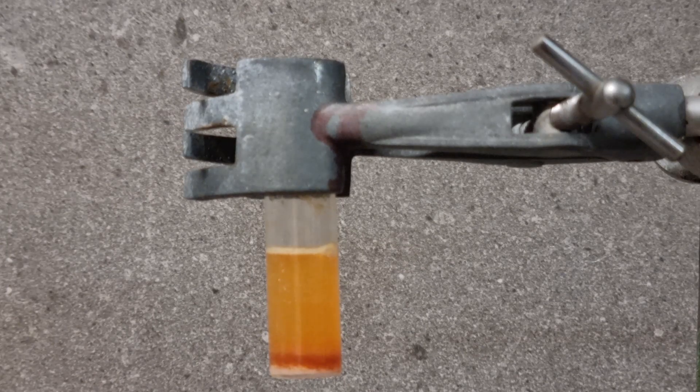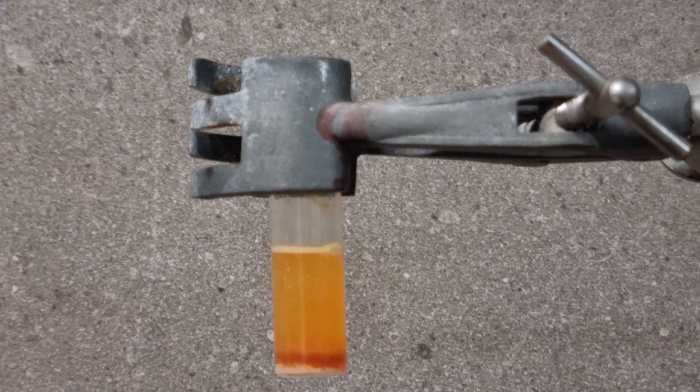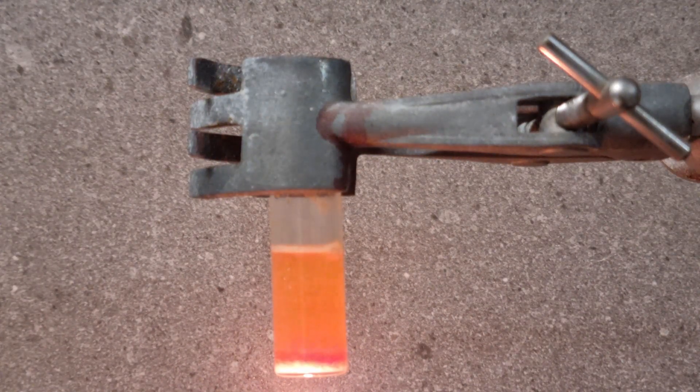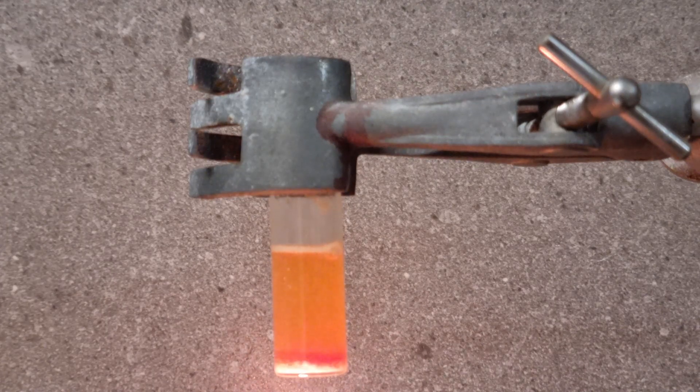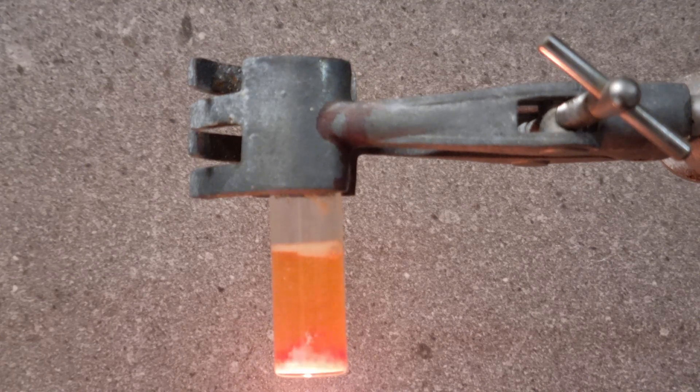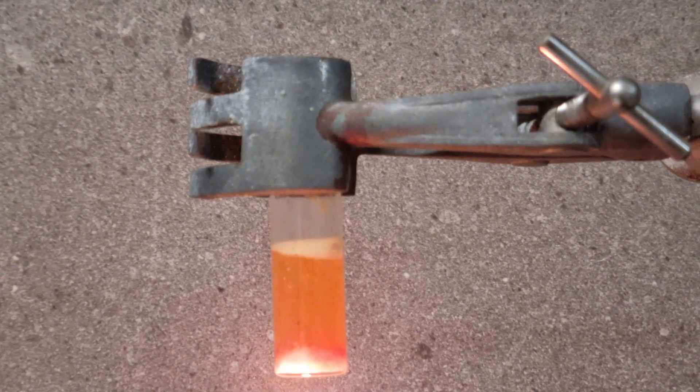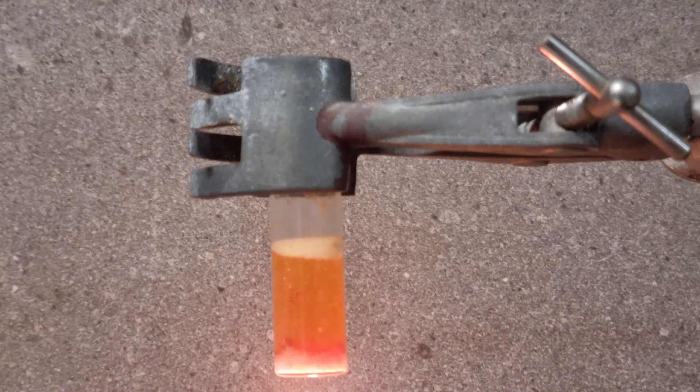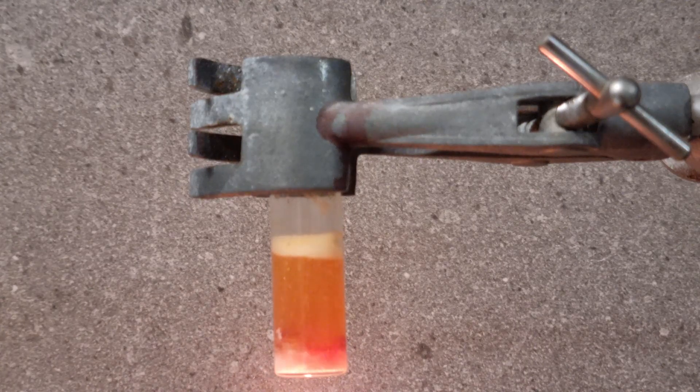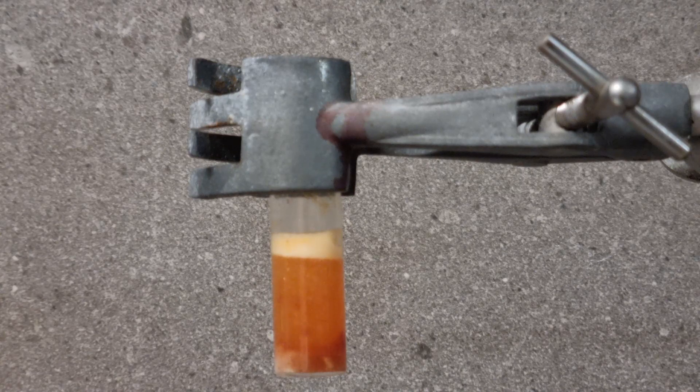The solution is gently heated and a precipitation is formed. Clearly some reaction has occurred, but the lack of pink is not encouraging. The precipitate is likely some sodium ferrite phase. We will probably try through electrolysis or direct solid state reaction next.